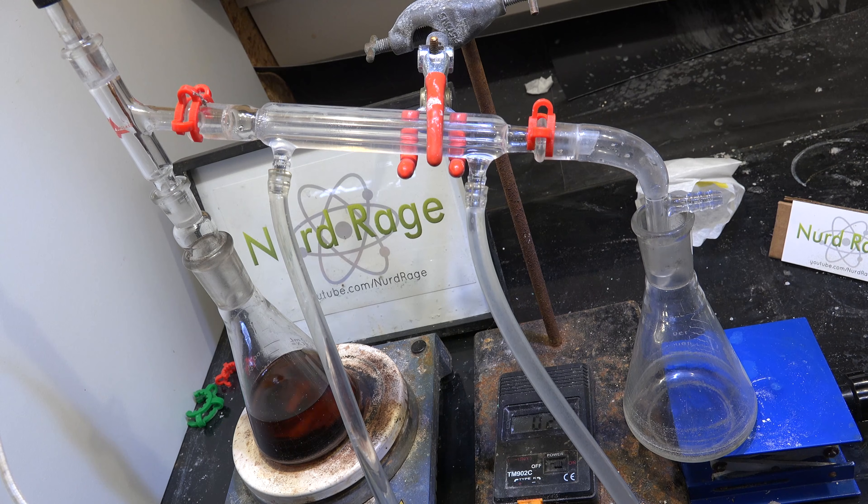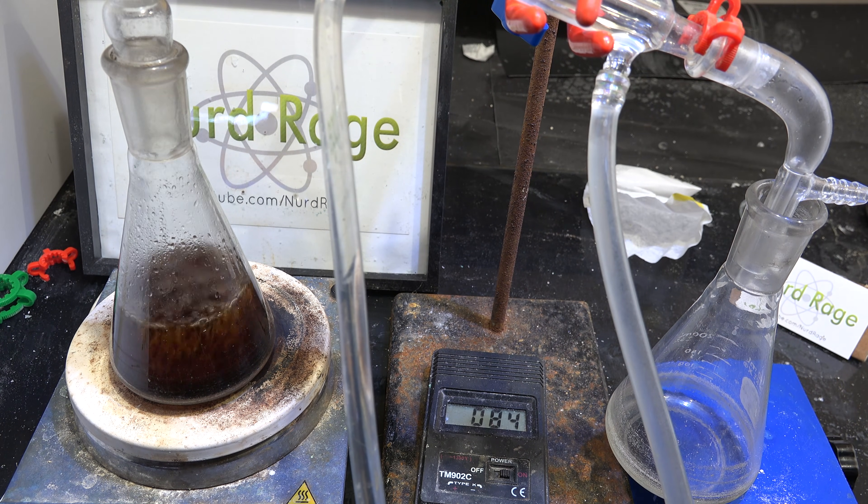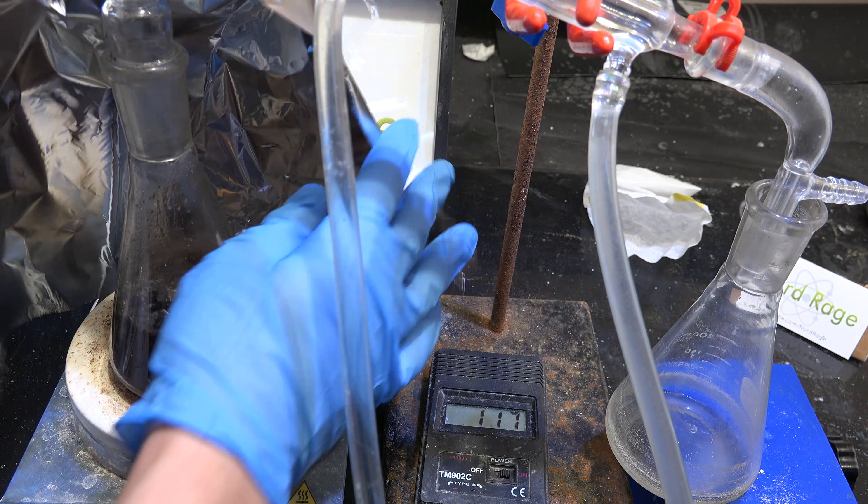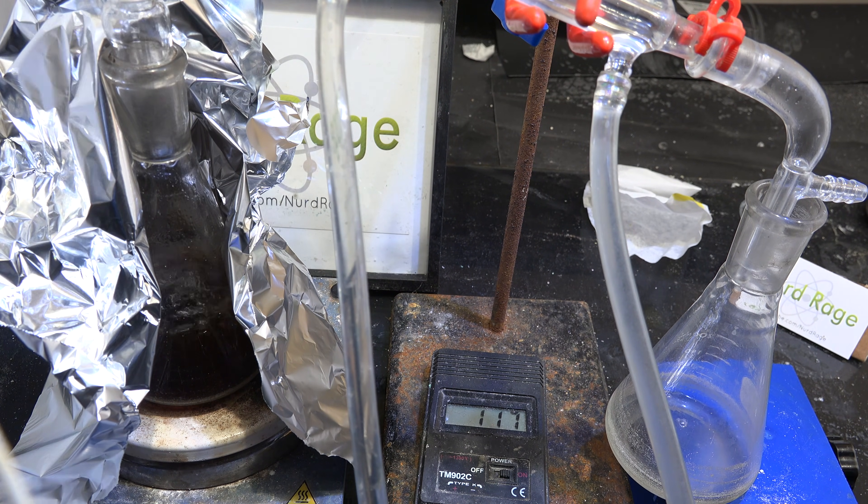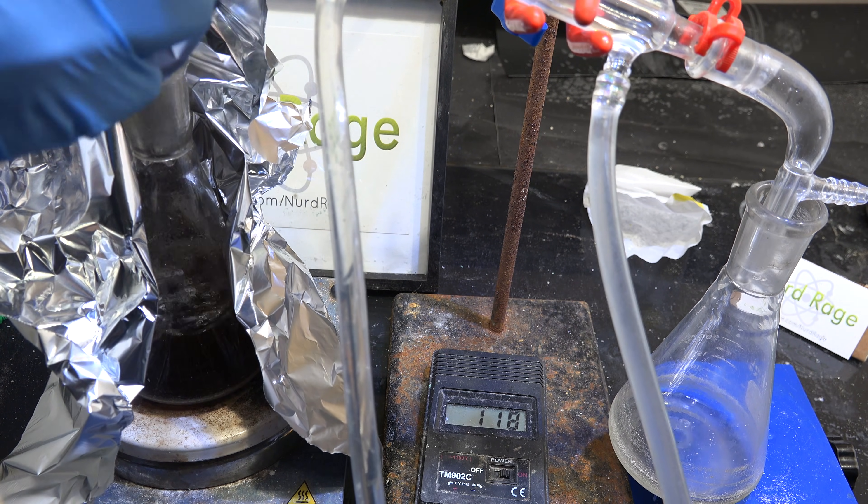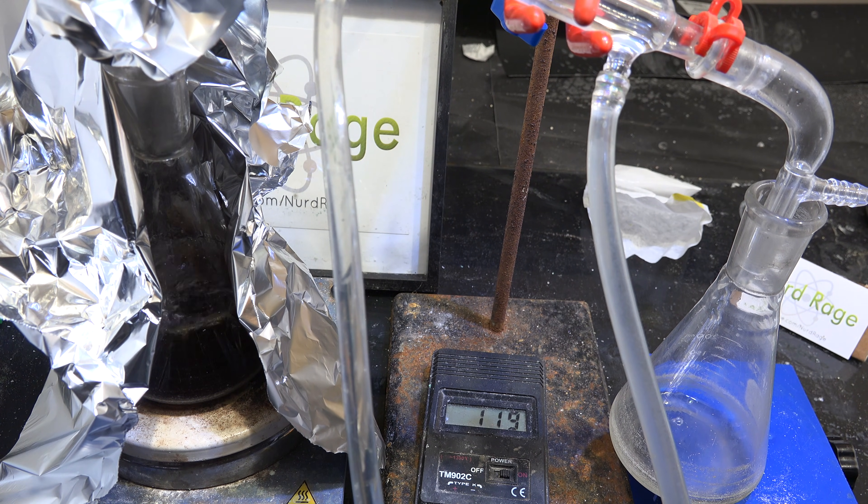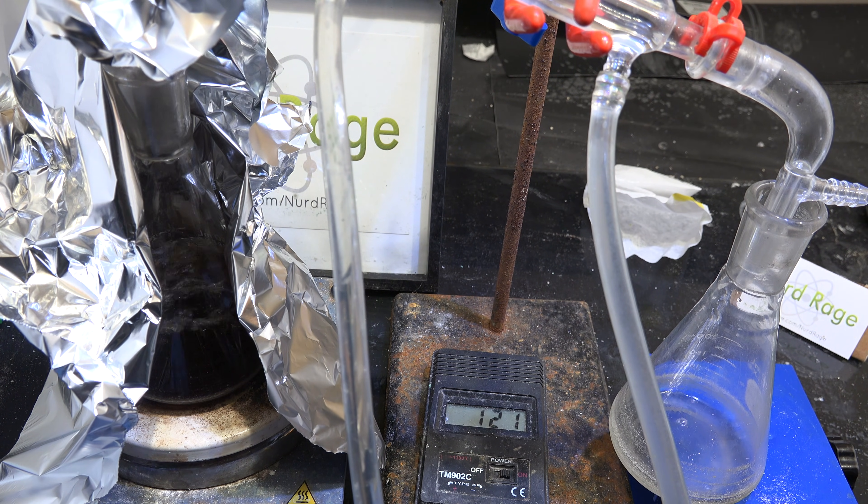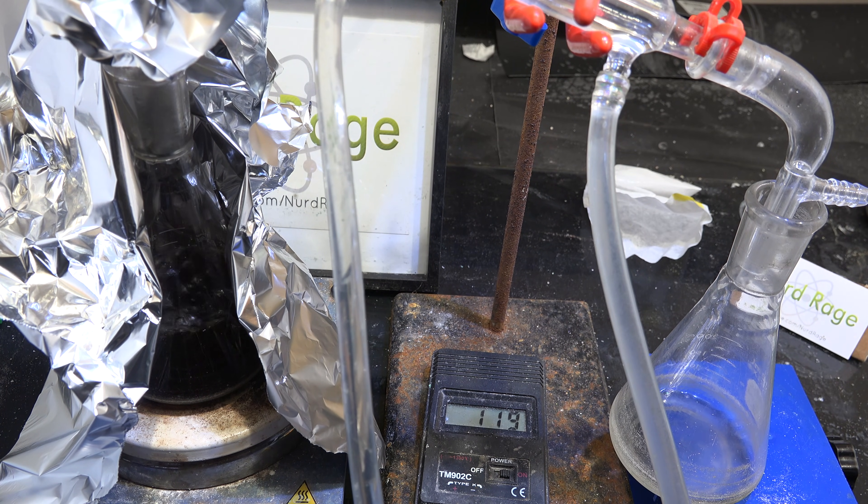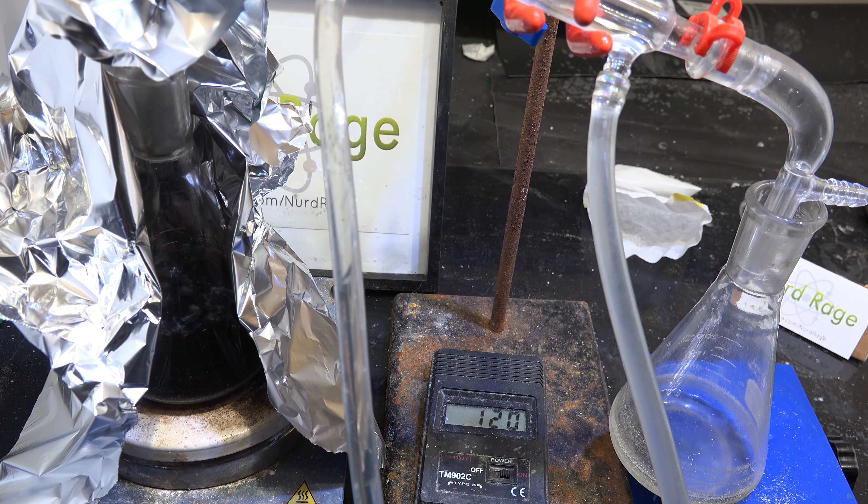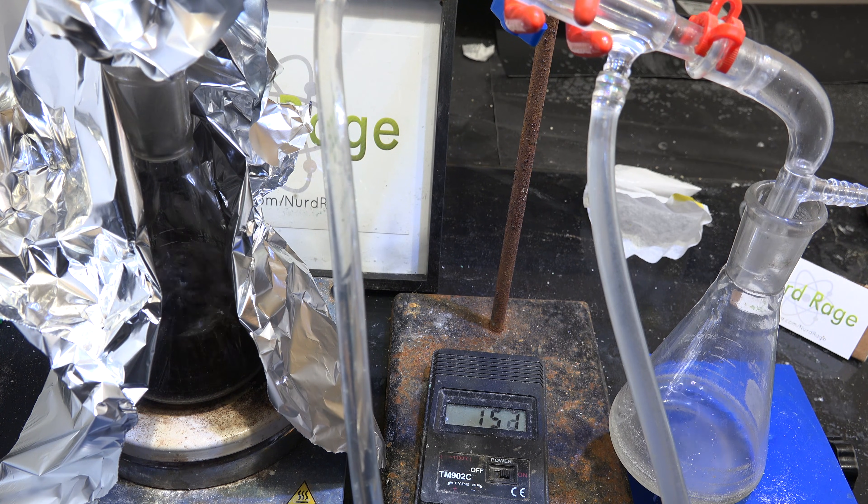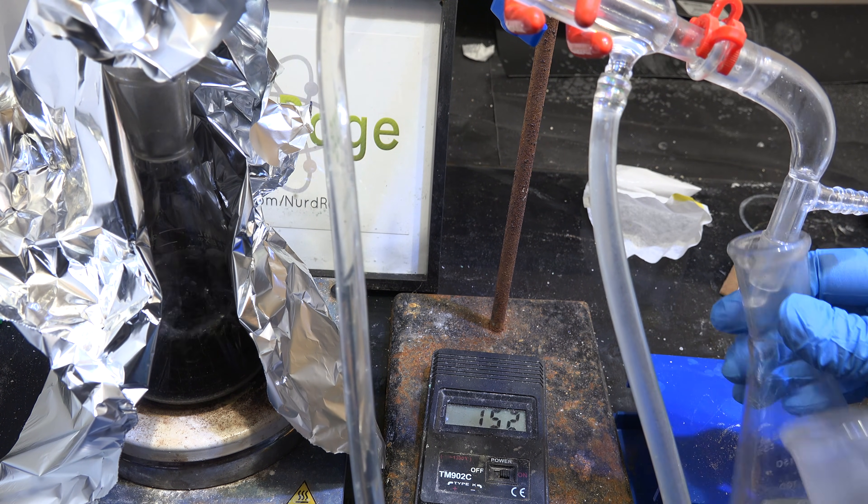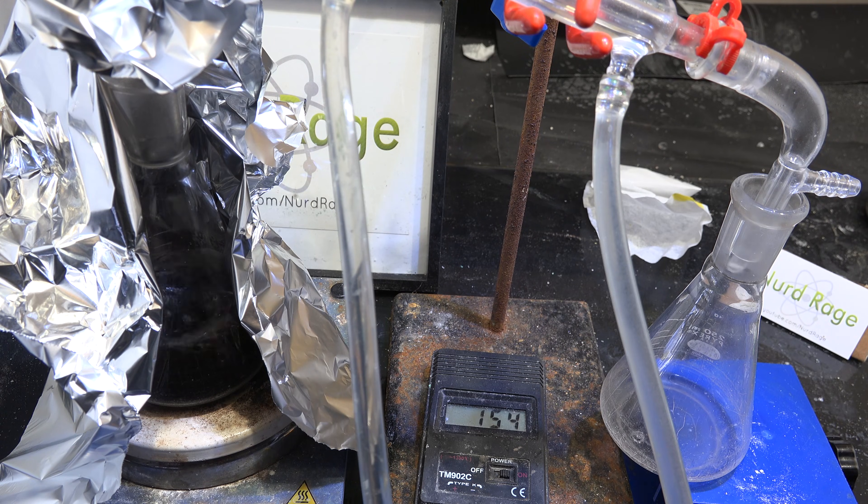Turn on the cooling water and start heating. You may need to enclose the boiling flask in an aluminum foil shroud to keep the heat in. What comes off first is an azeotrope of bromohexane as well as water and hydrobromic acids. It'll actually phase separate when it cools so you can save this and separate off the aqueous products for increased yield. Now bromohexane boils at 154 celsius so when the distillate temperature reaches around 150 celsius, change out the receiver and collect the bromohexane.